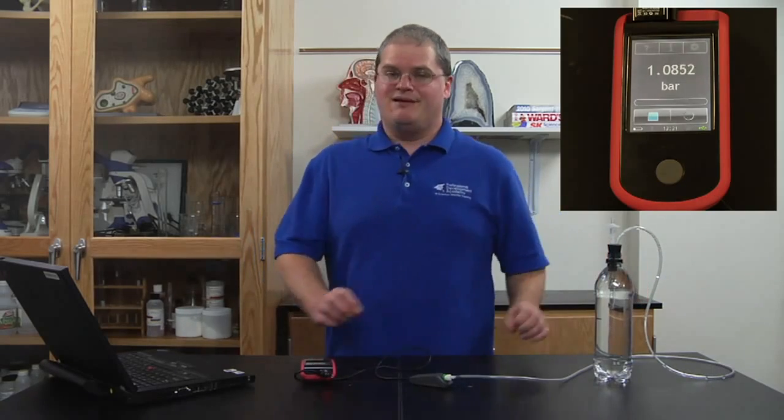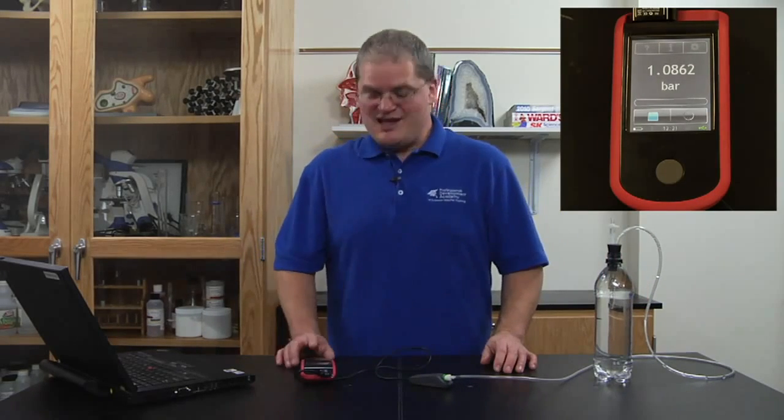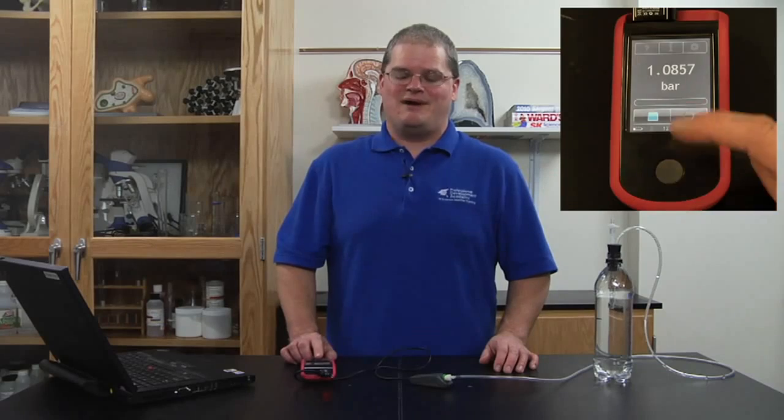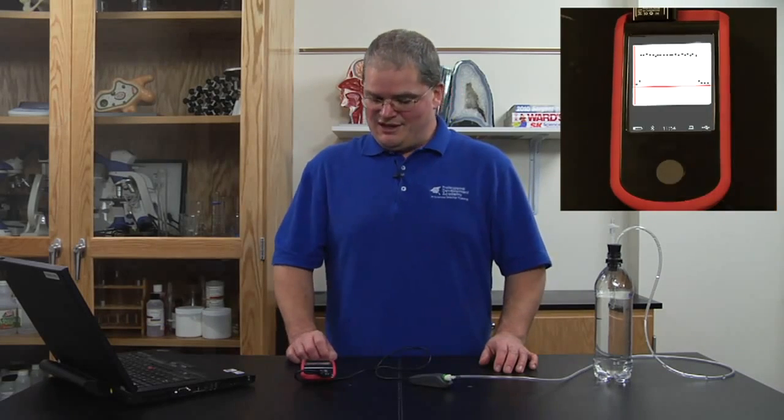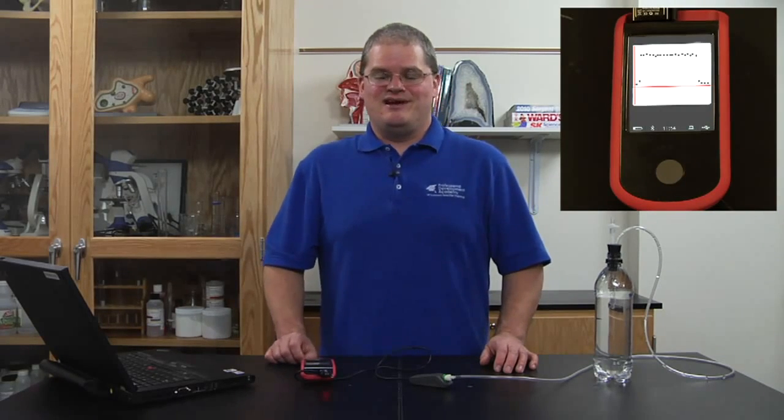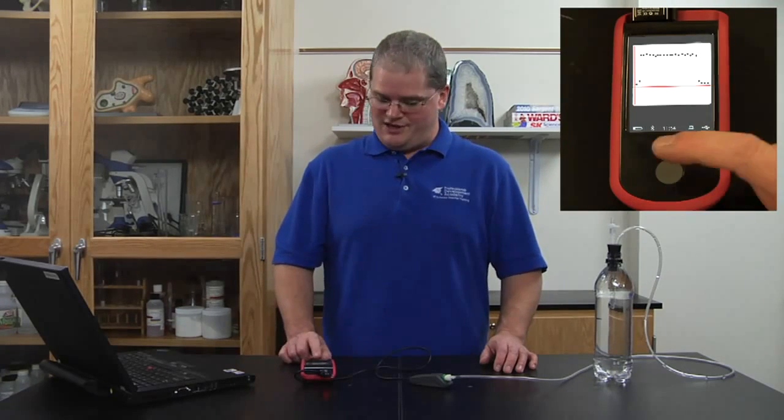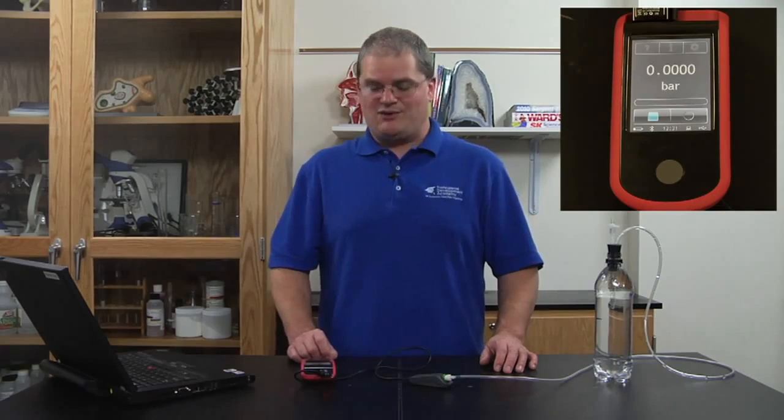Before I stop, I'd like to point out another feature. If you press the button at the bottom of the unit, you can get a graph that shows what has happened so far. If you push the button again, you return to your record screen.